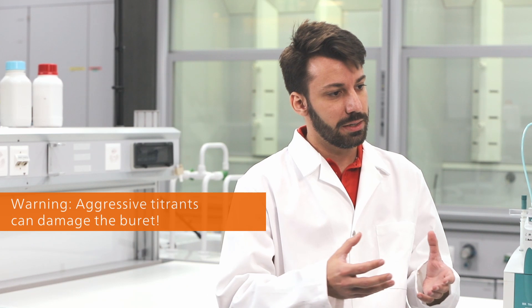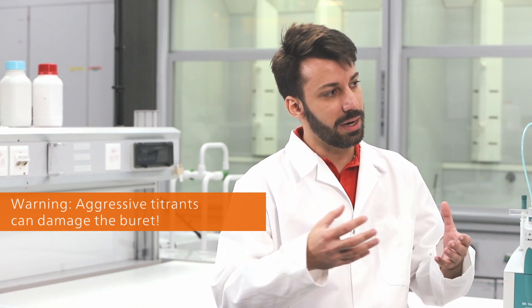Okay, and what can be issues with the burette? The burette is a wearing part. So it's normal that after some time of use, you start to have scratches. At last you can also have leakages on there.